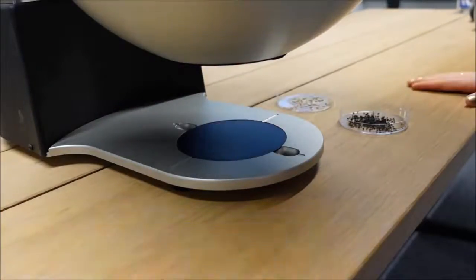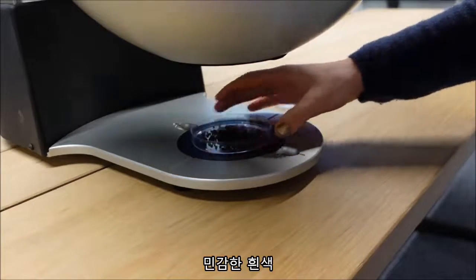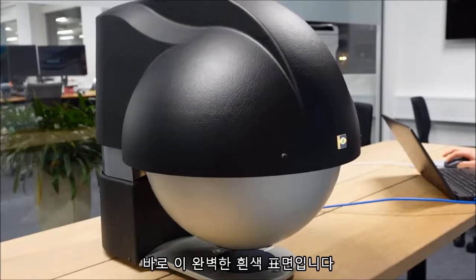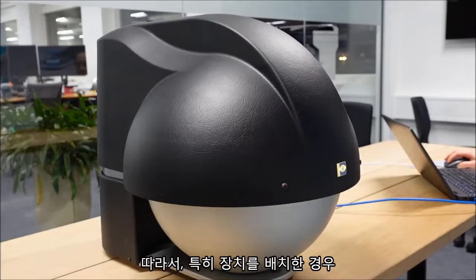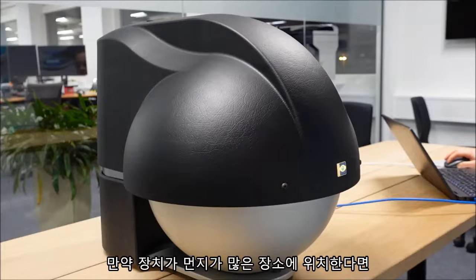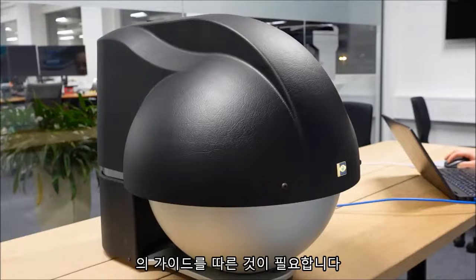The inside of the dome is painted with some very expensive and sensitive white paint. It is this perfectly white surface which ensures that the light is correctly diffused inside the dome, so that the device can capture the high quality images. Therefore, it is highly recommended to keep the dome closed when not in use, especially if the device is placed in dusty areas or labs. In the case where the device would need cleaning, contact Videometer for further guidance.